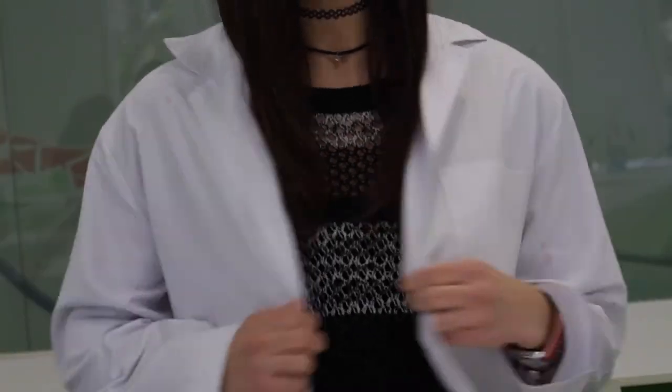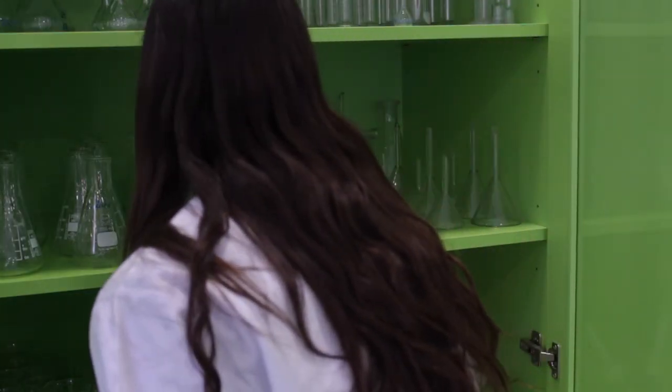So let's put on our lab coat, strap on our gloves, and get everything we'll need in the experiment.